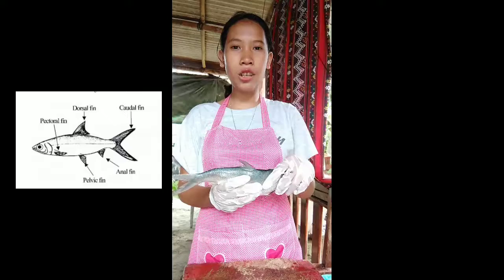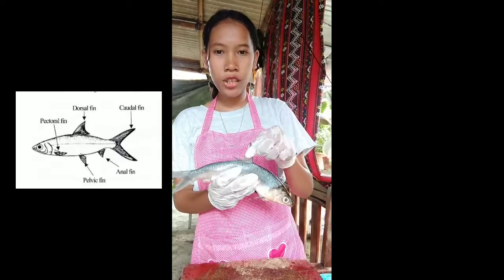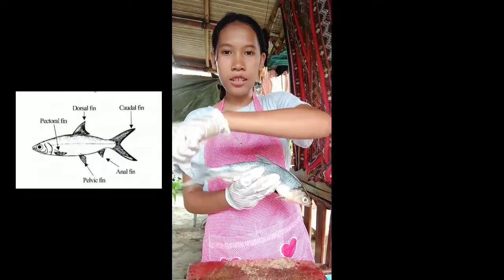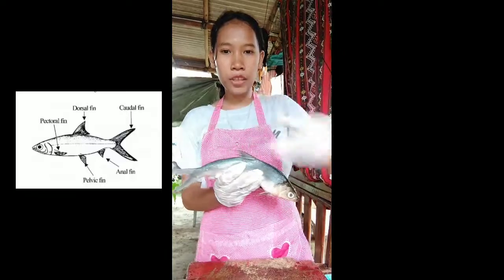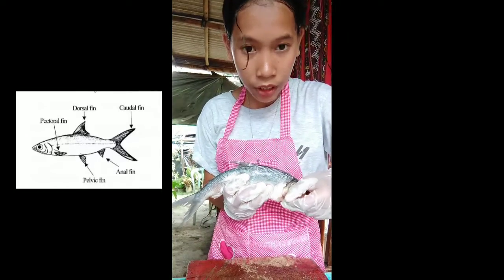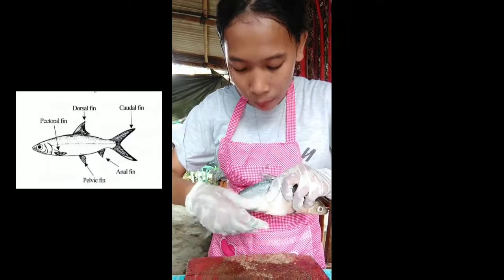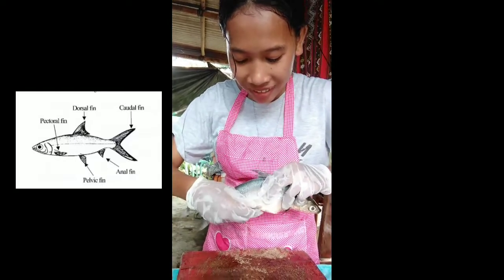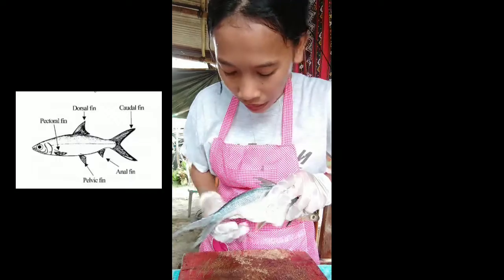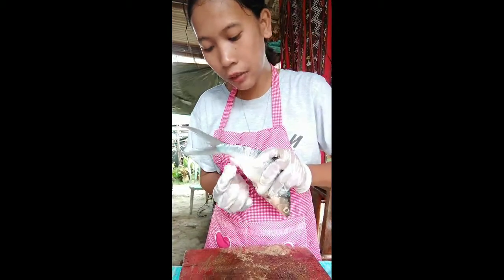So this is the fins of the fish. This one is the dorsal fin. This is the caudal fin. This one is the pectoral fin. And this one is the pelvic fin. And this one is the anal fin.